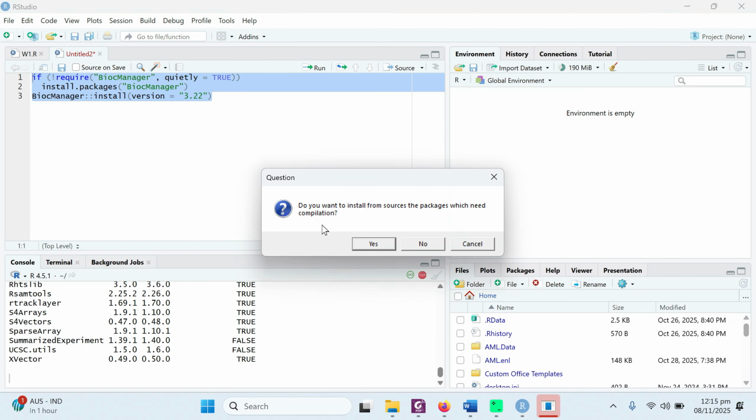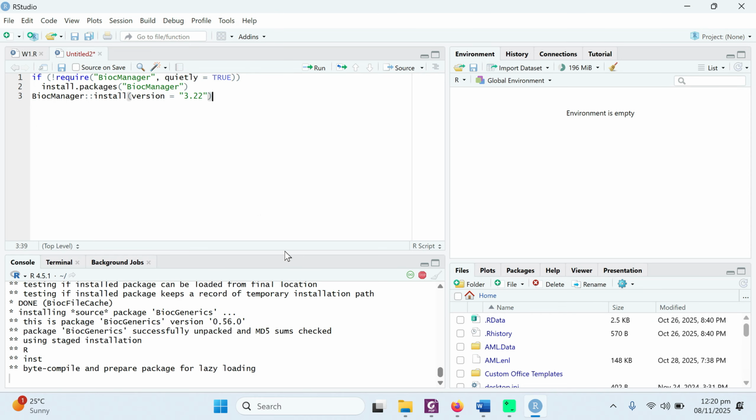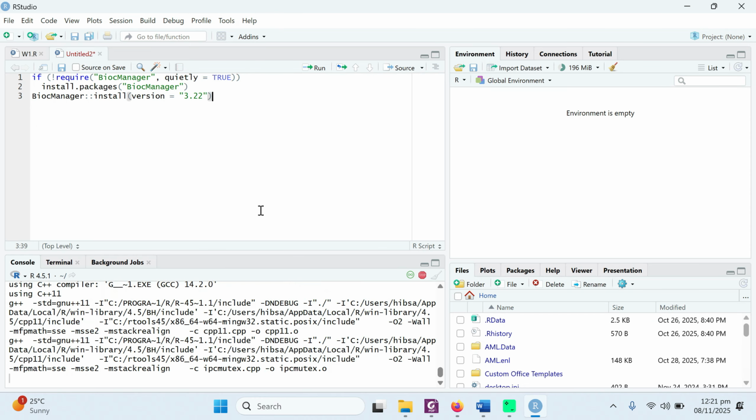Now it's installing multiple packages. The main core package, Bioconductor manager, BiocManager, is 3.22. Right now this is the latest version. When you are trying to install, maybe it has been upgraded to some other version, but you need to install the latest one, and it is recommended to always take the command and install the package from the Bioconductor main website. So we need to wait until it completes installing all the packages.